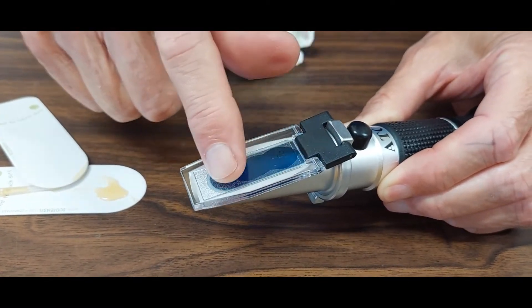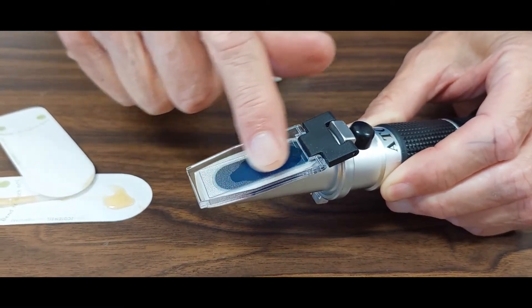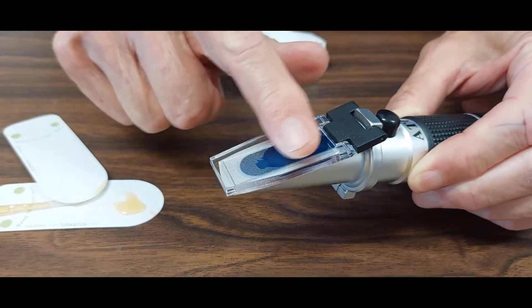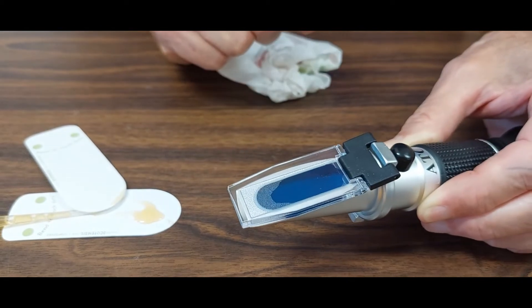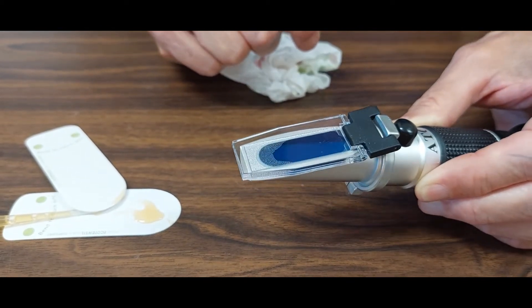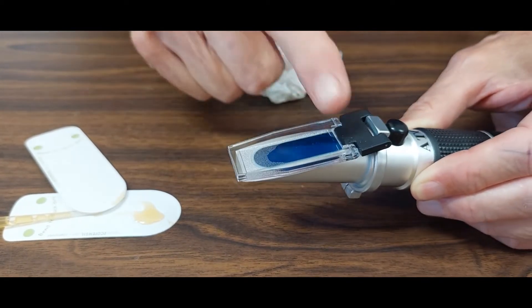And you see it's starting to spread. And I take my finger and I press down, rub it back and forth with some pressure, working any bubbles out and getting it to completely fill. That's an under-filled sample. That will not give you a correct reading. It didn't spread up into here.